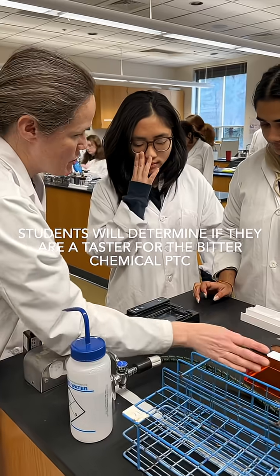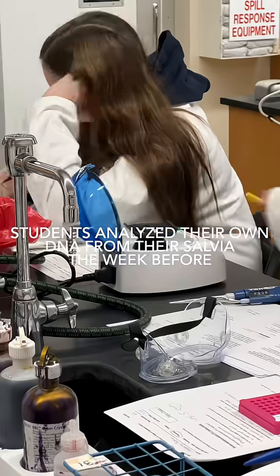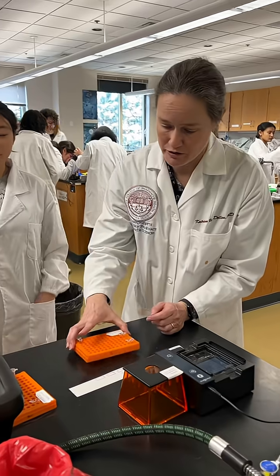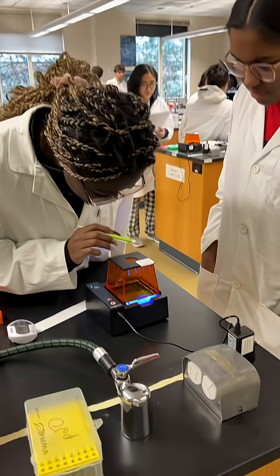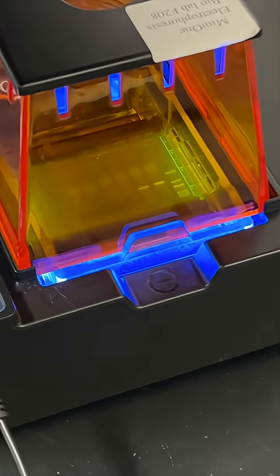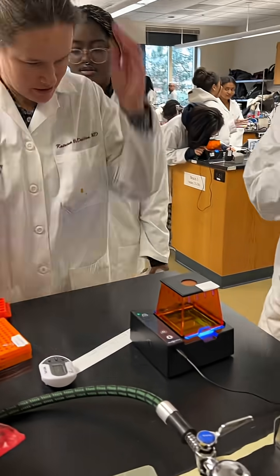And while it does it, it'll kind of rinse over the gel. You're ready to load, and then just like you practiced, you're just going to get 10 microliters of liquid. It's like the DNA is moving. Are you ready? Does it look ready? Mm-hmm.